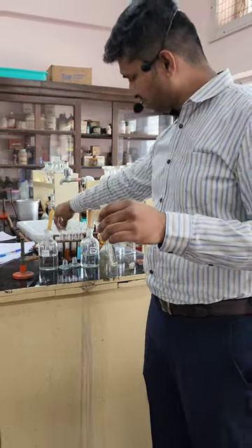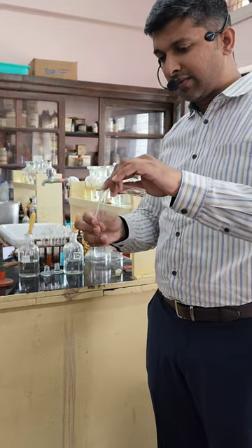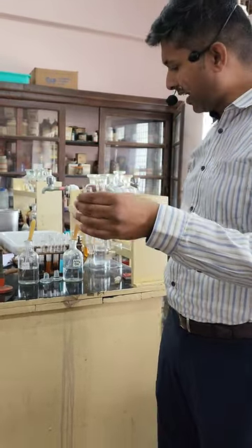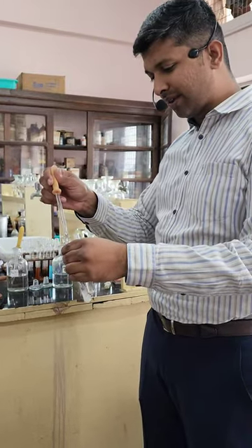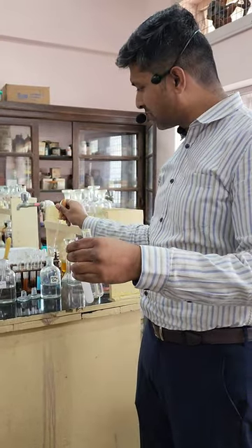Zinc Nitrate. Even if Malibya did not tell us that it is Zinc Nitrate, we will be able to identify it. How? By adding NH4OH to one of them and NaOH to the other.